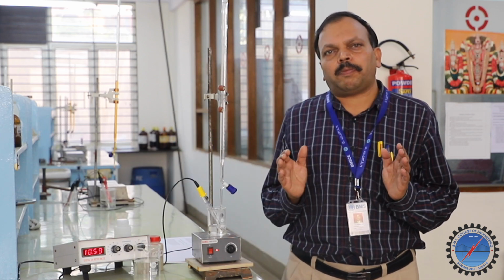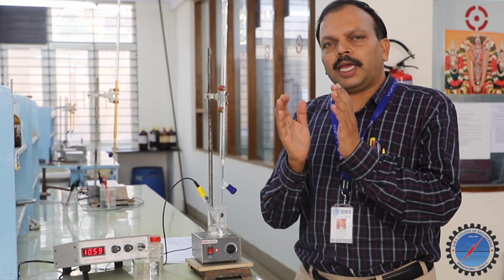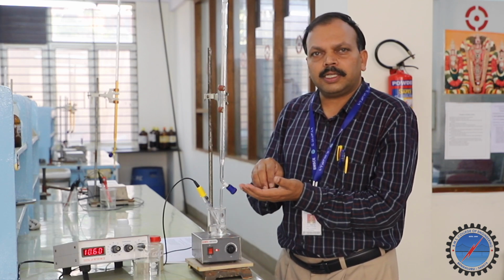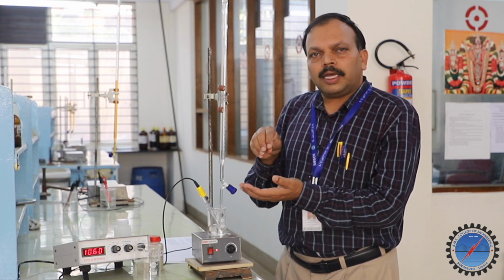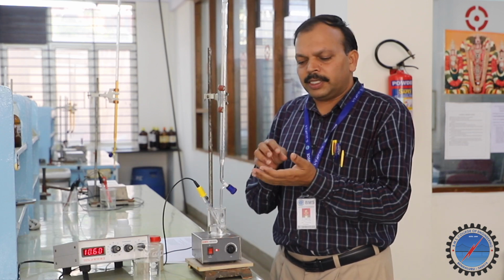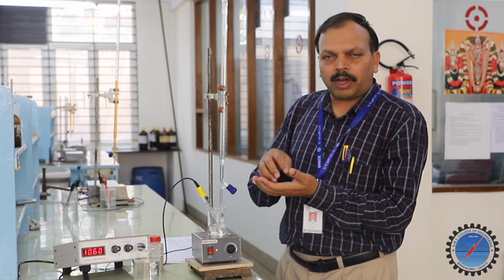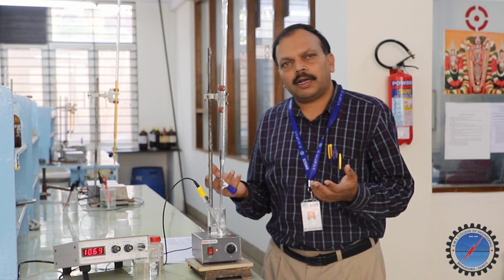See, what is this particular point? Up to the previous reading before adding this 0.5 ml, the added sodium hydroxide reacts with the acid inside. The acid may be acetic acid, formic acid, or chloroacetic acid. Whatever acid we have taken to determine its pK value, with the sodium hydroxide the general tendency is a neutralization reaction, and salt and water are formed. If it is acetic acid, sodium acetate salt. If it is formic acid, sodium formate salt is formed, and water is the side product.